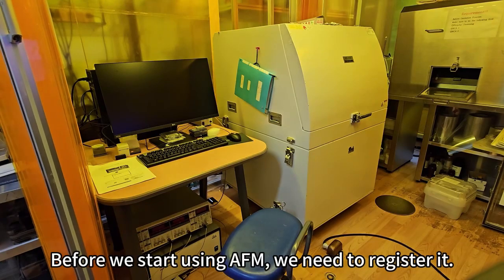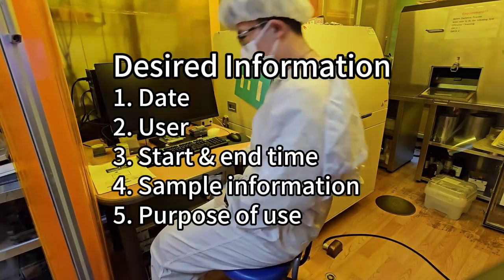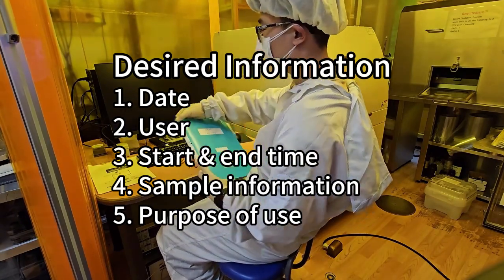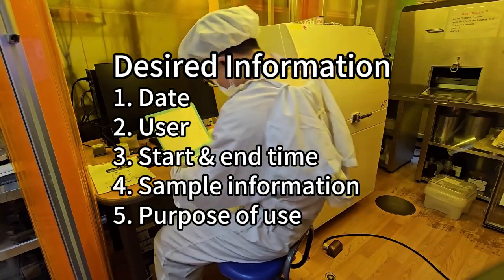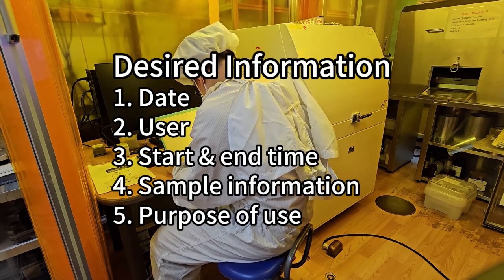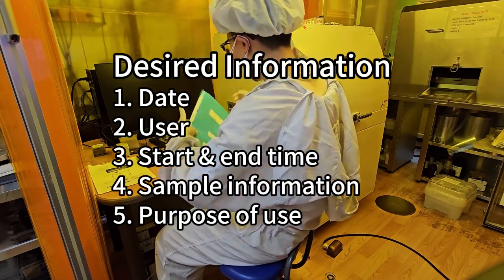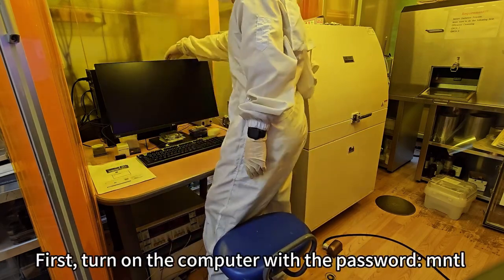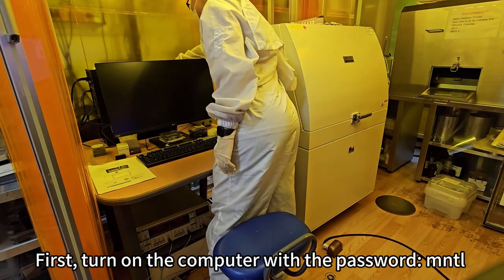Before we start using AFM, we need to register it. First, turn on the computer with the password MNTL.